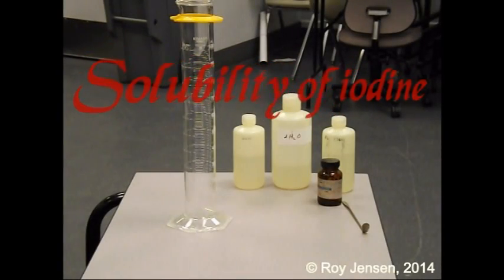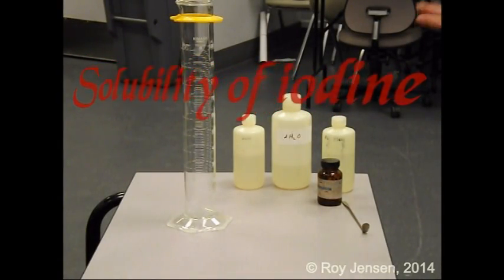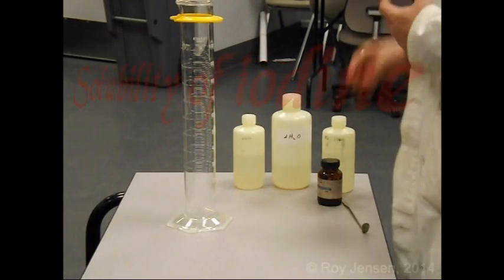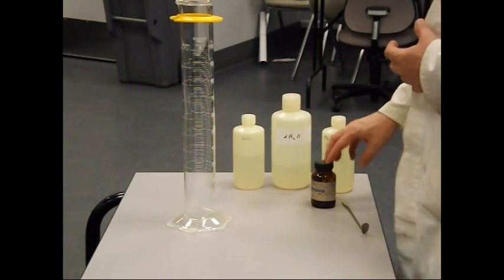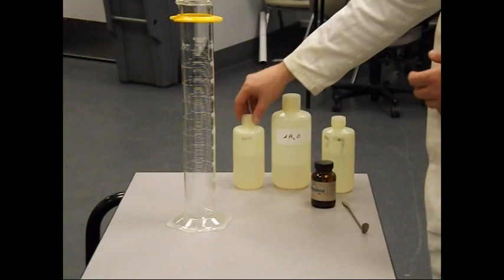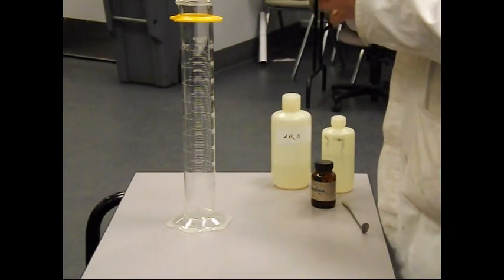We're going to look in this presentation at the solubility of iodine in various solvents. So the first solvent we've got is dichloromethane.